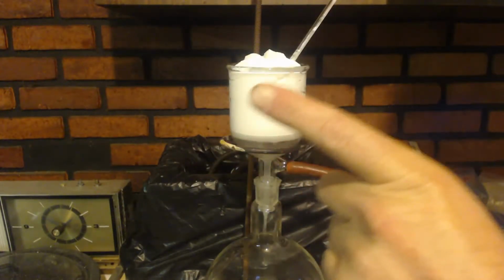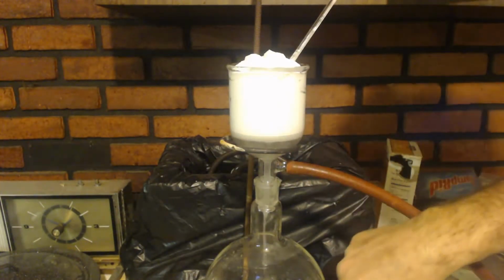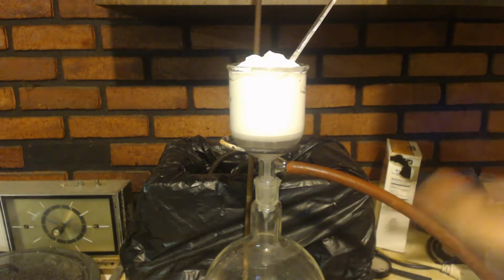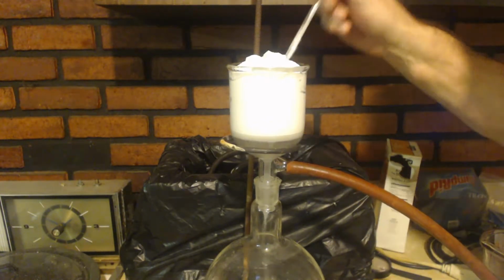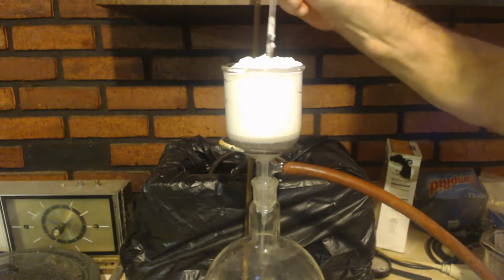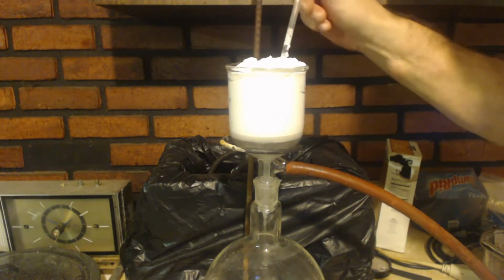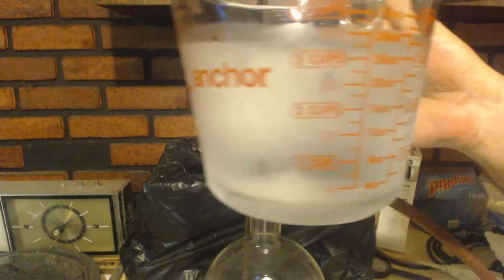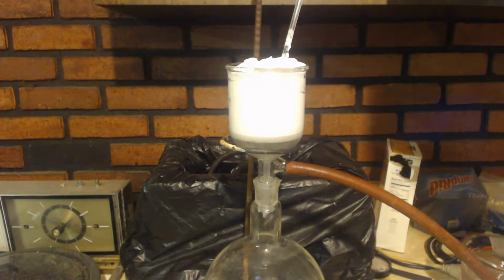Now I forgot to say, I did a pH of this water, and it is a pH of 1. Because you do want to have excess HCl, not excess sodium benzoate. Because HCl won't recrystallize in your product, whereas if you have a little bit of sodium benzoate, maybe it will a little bit. So I'm going to push out a little bit of water and put it in there. And I'm going to pour this liter of cold water through here as I stir it up and wash it to get the sodium chloride out of there and get that excess HCl.